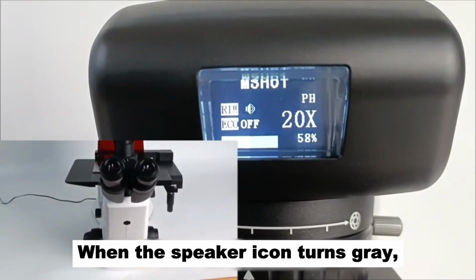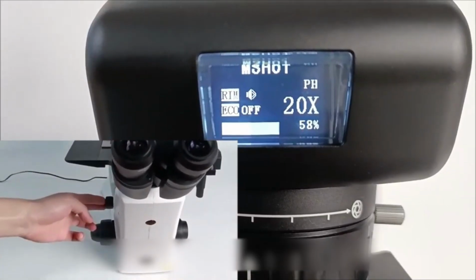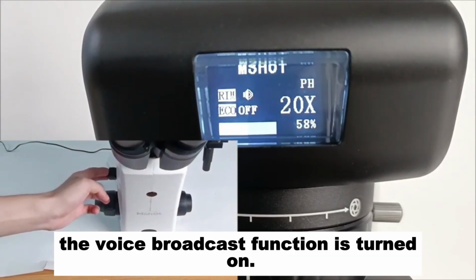When the speaker icon turns gray, the voice broadcast function is turned off. When the speaker icon lights up, the voice broadcast function is turned on.